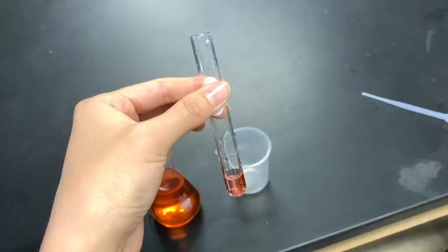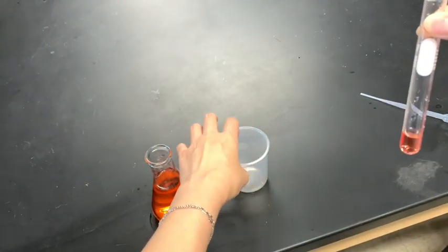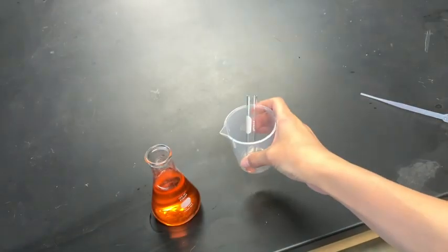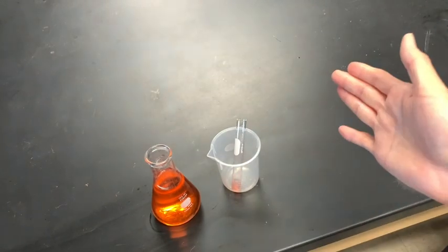To safely store your test tube, get a glass cup or a mug and place your test tube in the cup, and you can set the cup on the table. That way your test tube with the solution doesn't tip over.